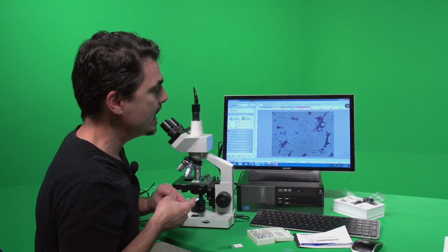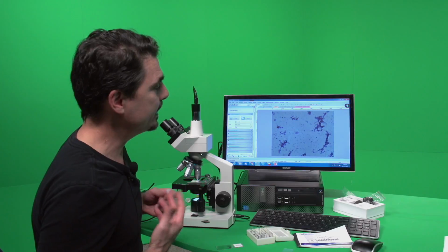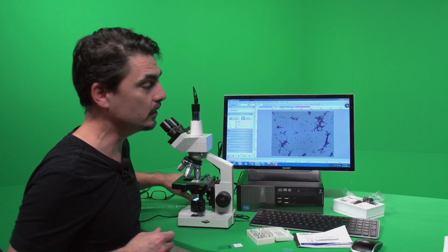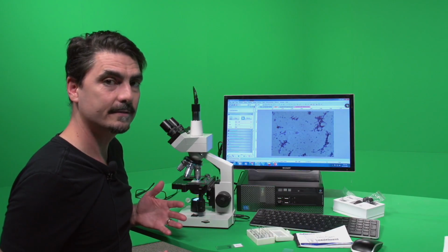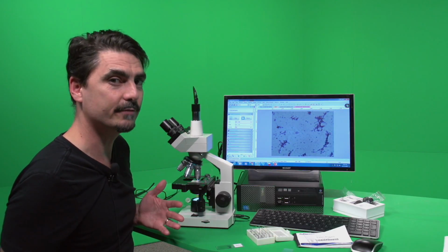Use that, label it. And if I was going to load that up, I would indicate, through my reading from the class and looking at images of what it should look like, that this does not look like Bacillus, and these are the reasons why. So that's part of this class. If something isn't as you expect it, and you've done everything right, it's your job to say, hey, it should be looking a little bit differently right now.